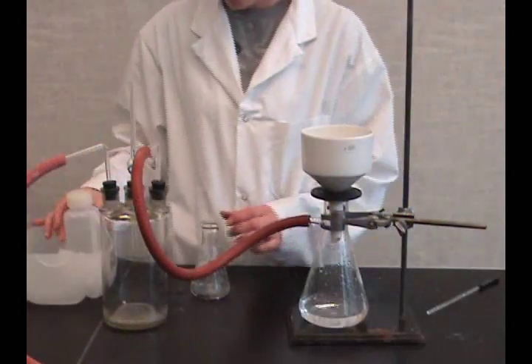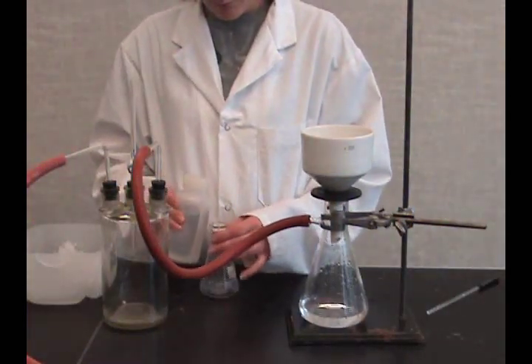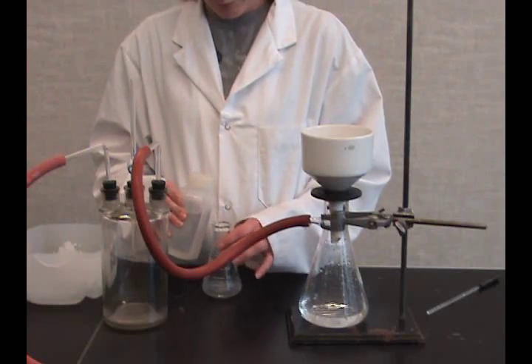When there is no apparent liquid in the funnel, reduce vacuum and pour portions of cold solvent onto the crystals. Swirl the funnel.